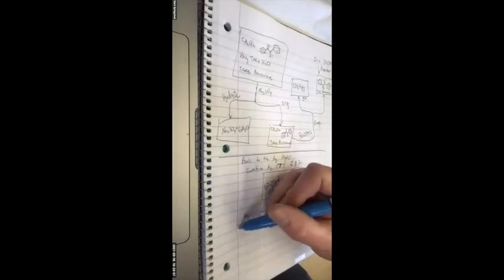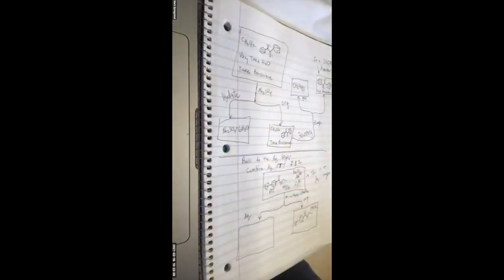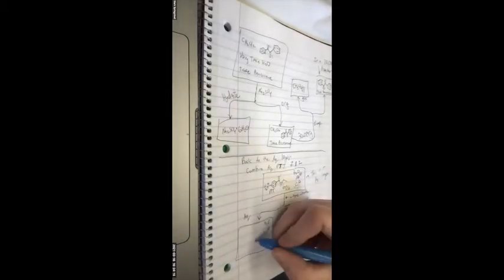Over here, your aqueous layer is mostly water. Sodium. What else is in this aqueous layer? Sodium. What else? Chloride. And do we have hydronium now? No, it'll still be hydroxide, basic, because when we add the methylene chloride, that's not changing the pH or anything. So we're just trying to get the organic molecule that's not soluble in water over into a soluble organic layer. And when we do it, we separate it from the ions.